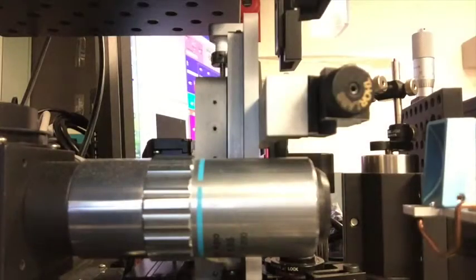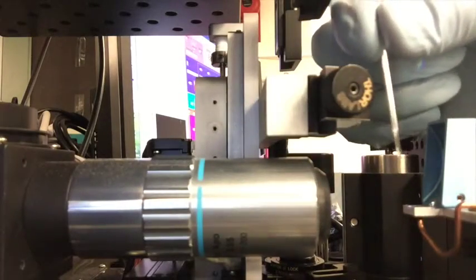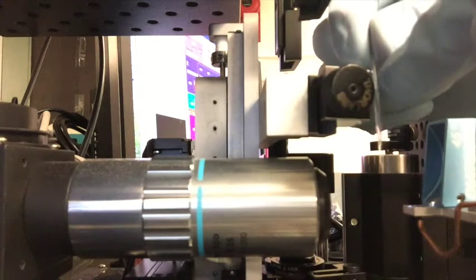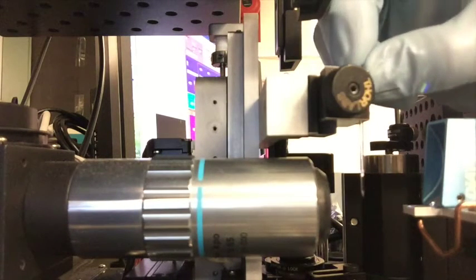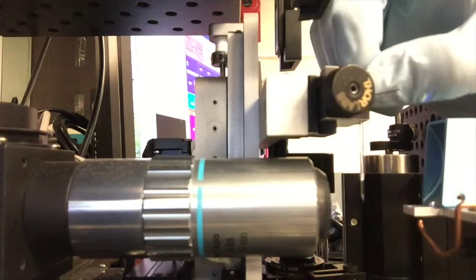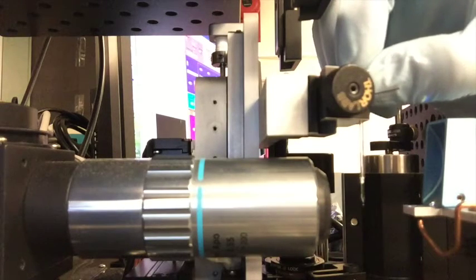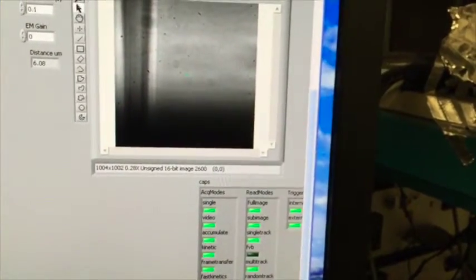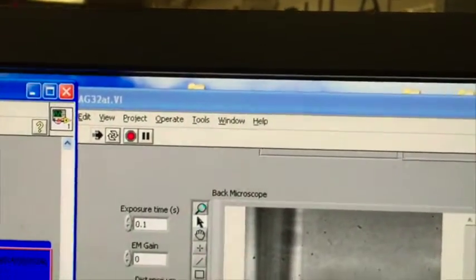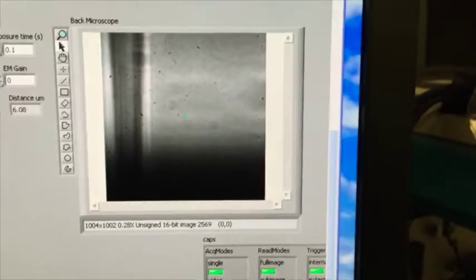So this is a glued tip. This is point down. I'm going to clip it into the mount, kind of push it down so it's almost flush, just under flush from the top. We can now see our tip right here in the camera on the Image 32 in our LabVIEW program.